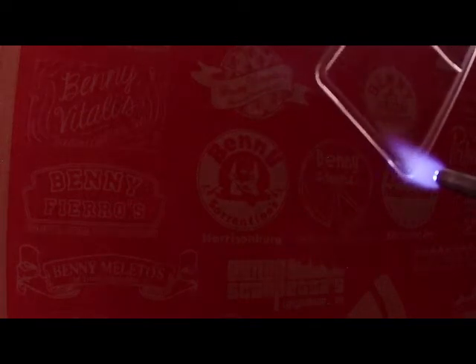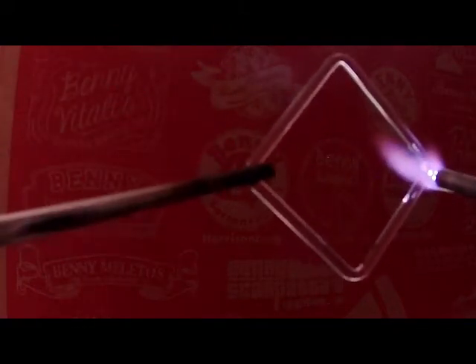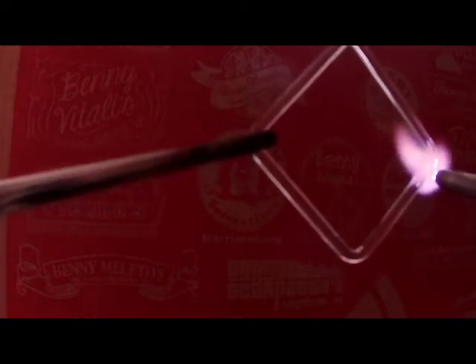What I'm going to do, actually, let me pull this back just a teeny bit. There we go. Right now, these two are, or this rod is not connected. In other words, it hasn't formed a weld. So I'm going to go ahead and get this. So I brought it out of the flame to hopefully make it a little easier to see what I'm doing. With my left, I'm holding the glass with tweezers. With my right, I've got plenty of 3 millimeter rod to act as a punty. And right now I'm just warming this up to get a reasonably good weld.